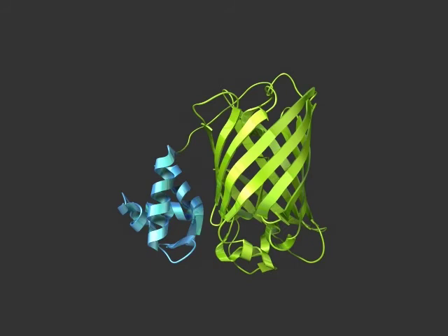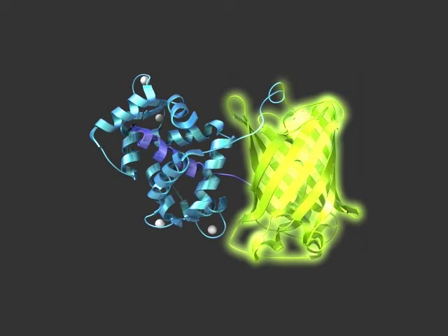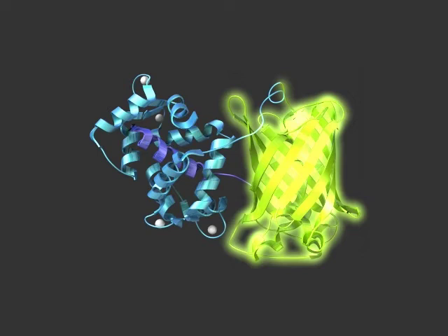Few interactions are maintained between the GCAMP protein domains, and as a result, GFP fluoresces minimally in the absence of calcium. In the presence of calcium, calmodulin undergoes a conformational change and is free to bind the M13 domain. This induces GFP to adopt optimal conformational changes for increased fluorescence, which can then be detected visually under a microscope.